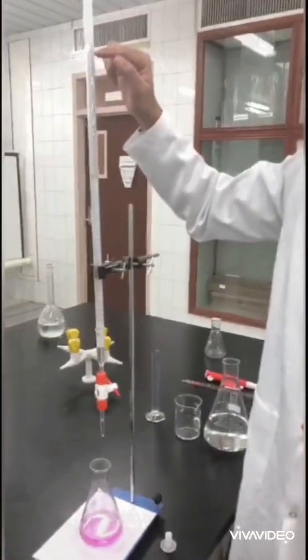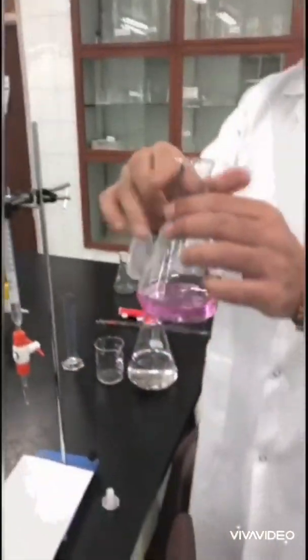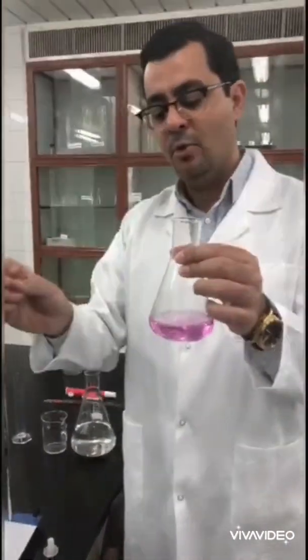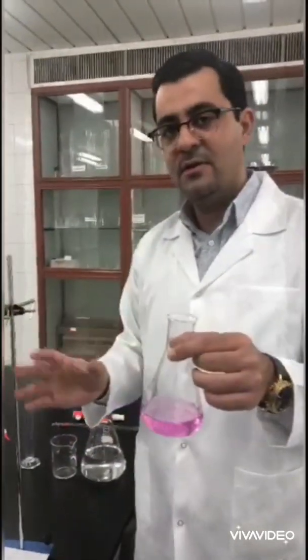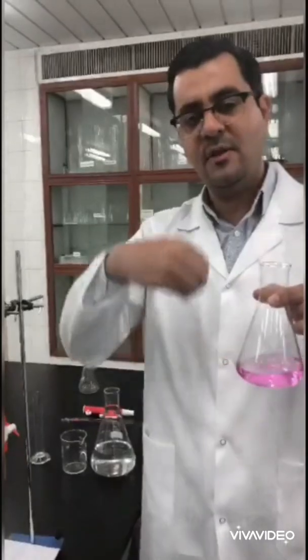What I am gonna do now: I will refill the burette with sodium hydroxide again, then I clean this flask. I will add HCl, 10 milliliters, a certain volume with phenolphthalein, and I repeat the same steps. Once I finish, the procedure will be repeated using H2SO4. By simple calculations, I can determine their concentrations as I will explain during the class.